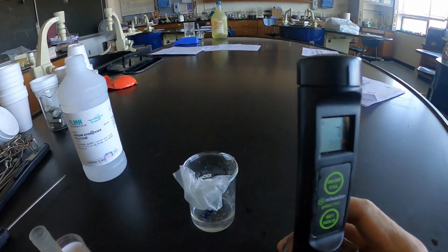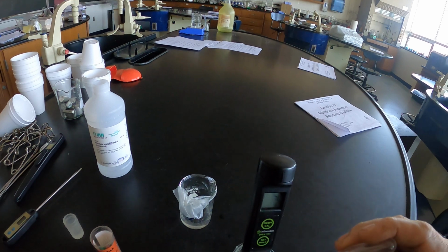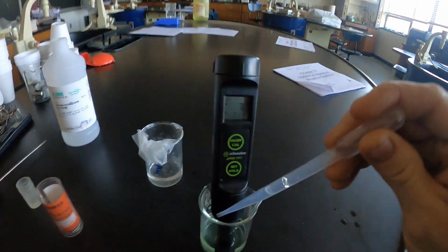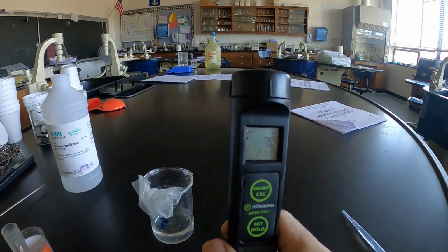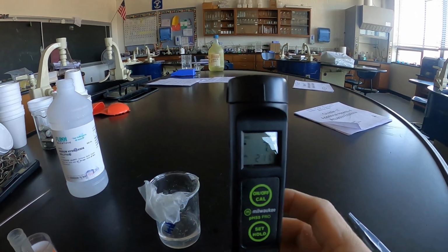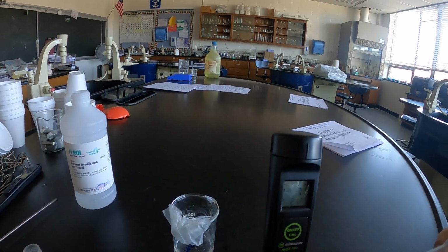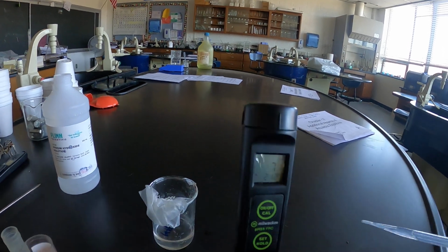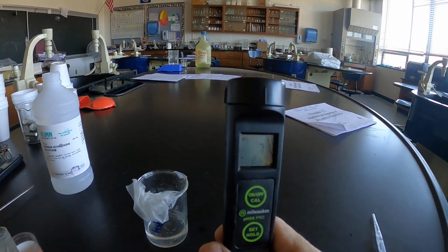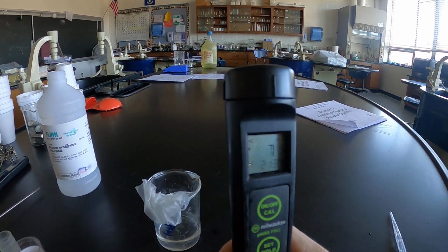Okay, this one is, again, in the pH 7 solution. And I'm gonna do the same thing. Couple additions of strong base, couple drops. And no change, 0.1. So we said buffering capacity is limited. It's not infinite. A couple more drops here. And another point change, not even actually.